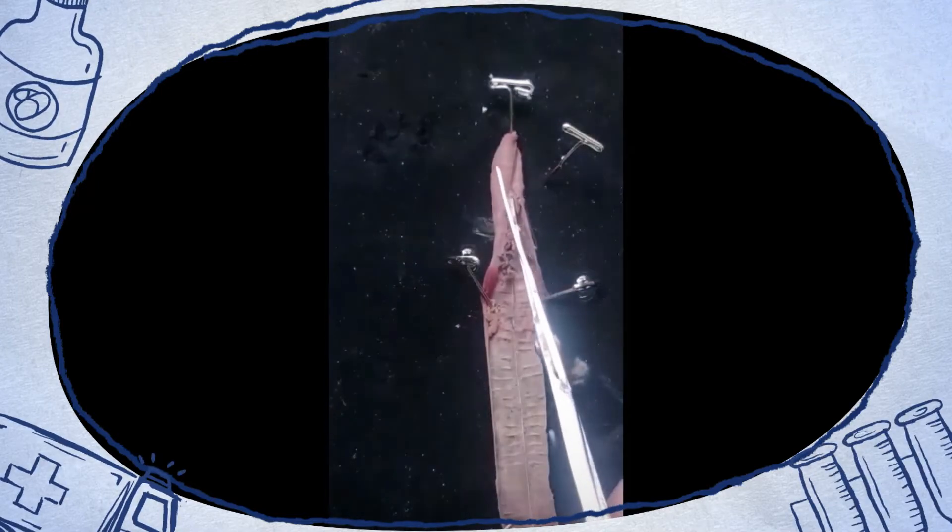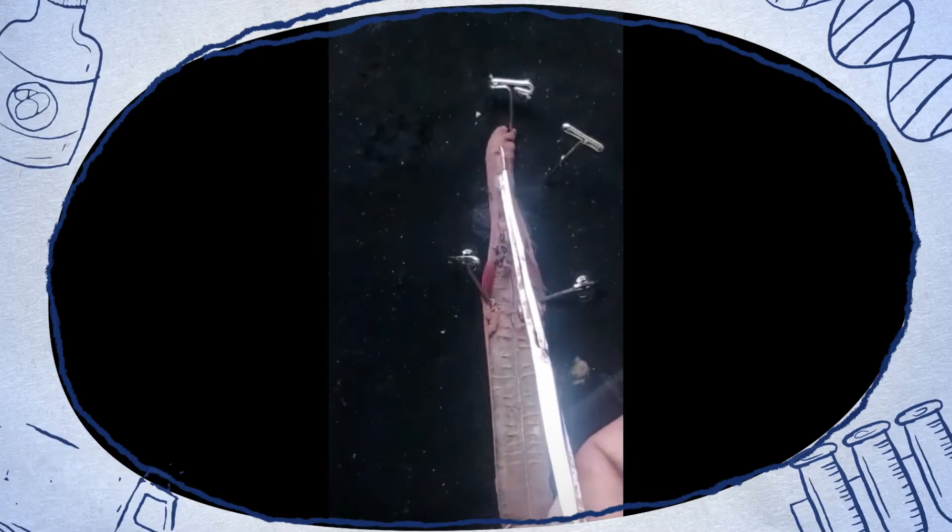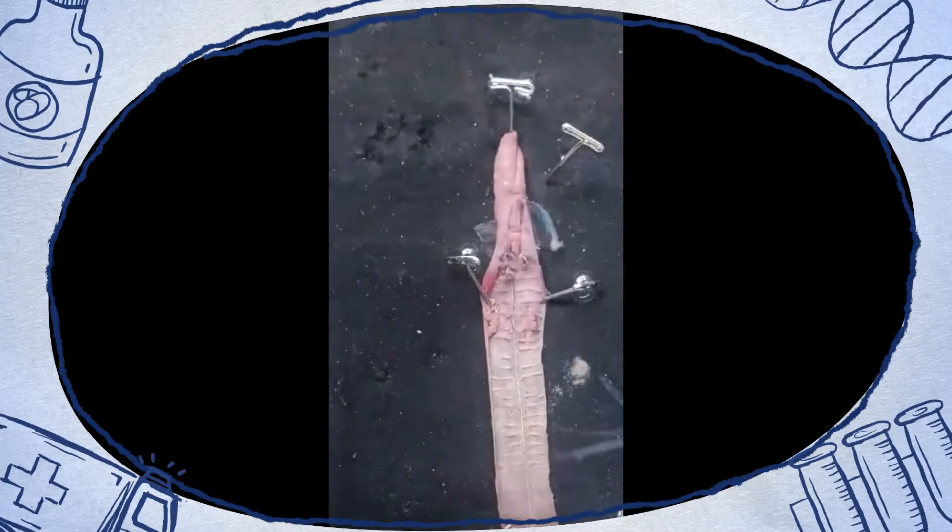Continue opening the earthworm in the preclitellar region.